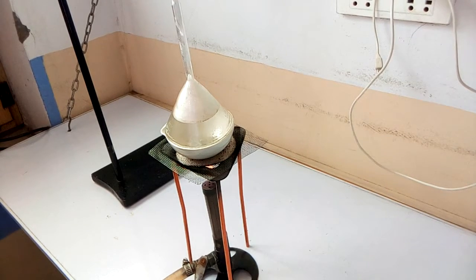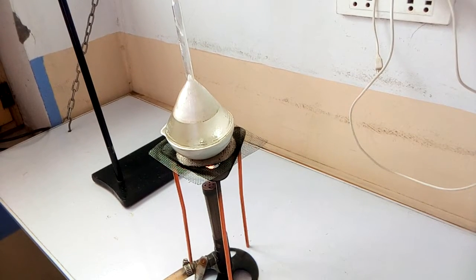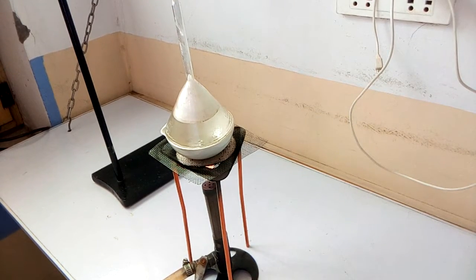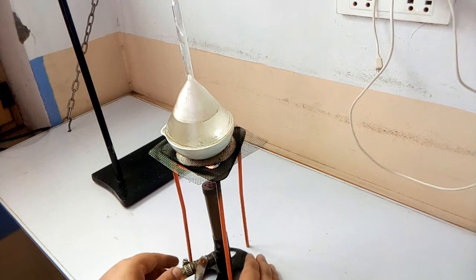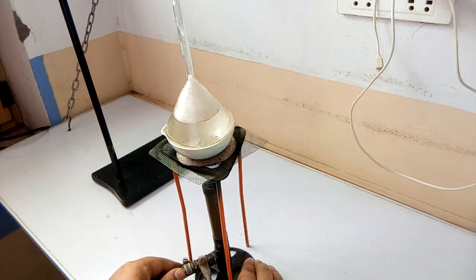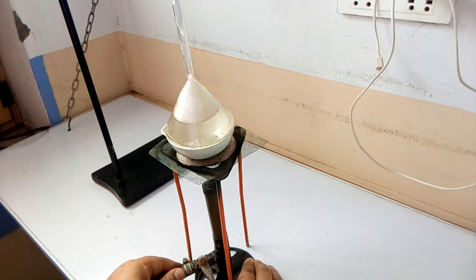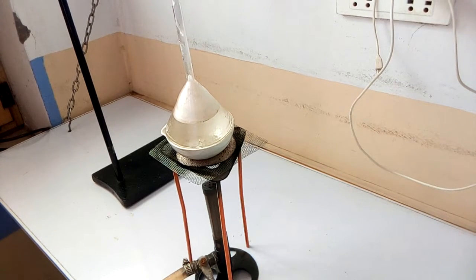Six minutes have passed, so we will turn off the flame now and allow it to cool down.